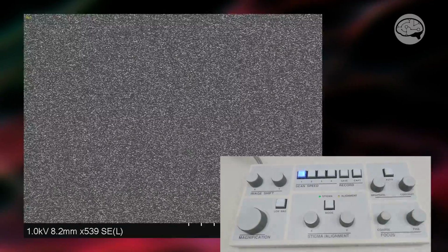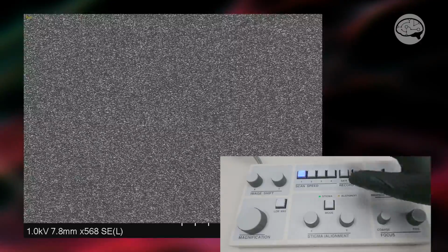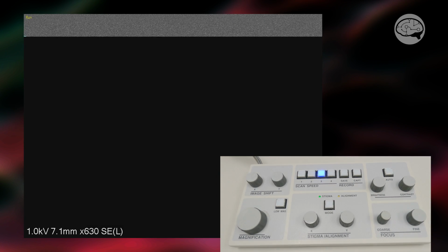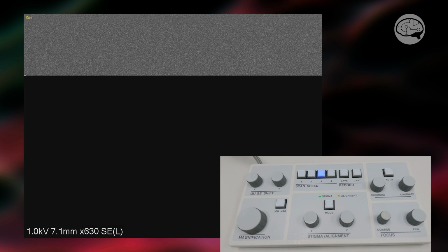You start off with a slow scan. Now, how slow the scan needs to be is up to you. I would say roundabout this slow is probably adequate for what we're doing right now. It could be slower for you, and it might even be a little faster for you. It depends. But I'm going to start the focus above where I know the sample is. Or I'll start it well below where I think the sample is.